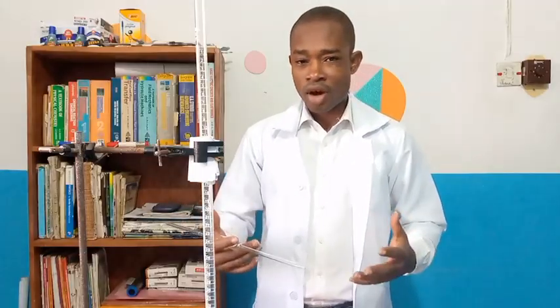All right, and so I'm set now to go carry out the titration experiment and display, of course, the table of values. I want to say this, please, because it's going to be part of the instructions on what we need to do based on the readings I'm going to get, the volume of the potassium permanganate that is going to be used for this reaction.